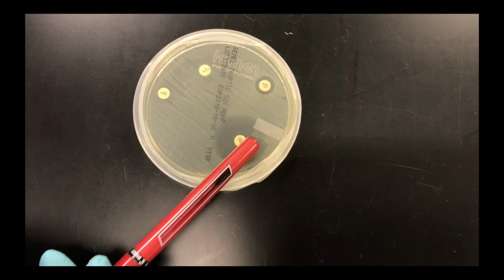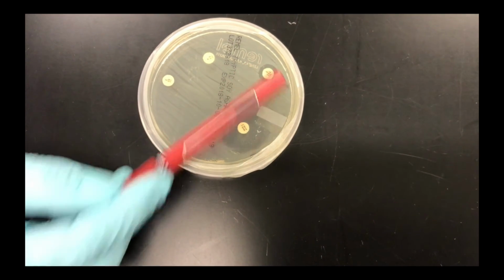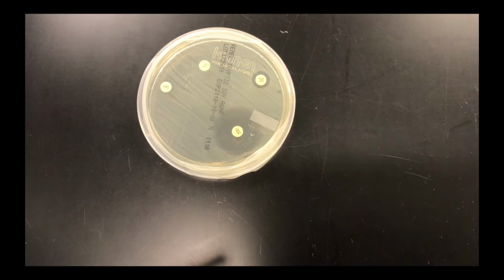What this looks like live would be like so. Now notice at the bottom right, you have that sort of clear area around the antibiotic disc, and that's where microbes in the confluent lawn couldn't survive. So they died. So that's its zone of inhibition. Compare that with the zone of inhibition much smaller in the top right, and the antibiotic discs on the left don't have any zones of inhibition. They were completely ineffective at killing that microbe.